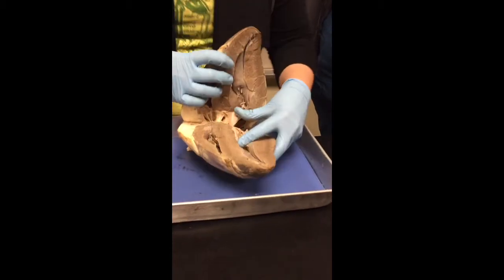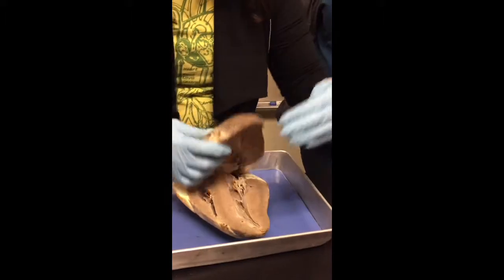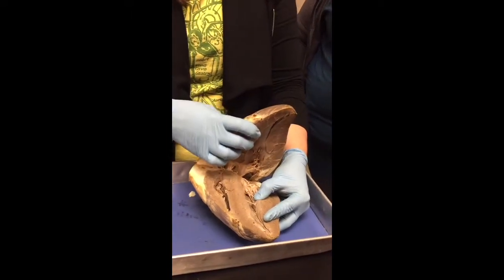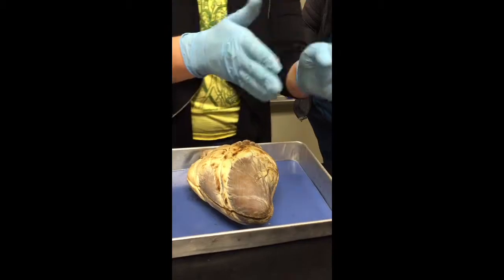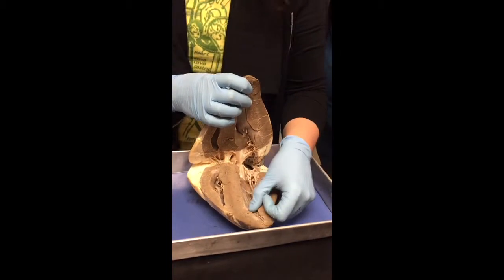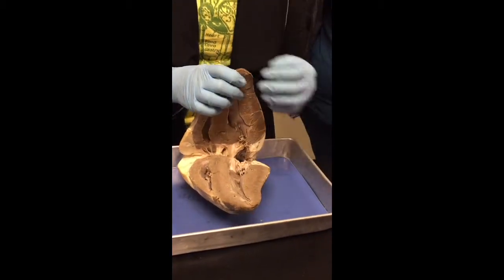Think of a tent, right? Here, this is the tent itself. Then you have these strings that kind of hold the tent, and then the stakes, which are the papillary muscles, that actually anchor it into the ground, okay? And this is, again, to prevent backflow. It only goes one way, right? And that way is from the atria down into the ventricles. Ventricles contract. It's going to push blood up and out.